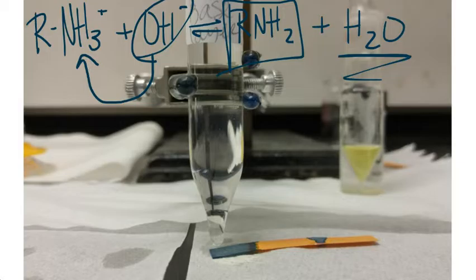After adding base to the solution, we check the pH on litmus paper to see if it's basic enough, and if it's basic enough, a precipitate will form if a base is in the solution. This does not happen, so the student does not have a base. And we move on to the acid portion.